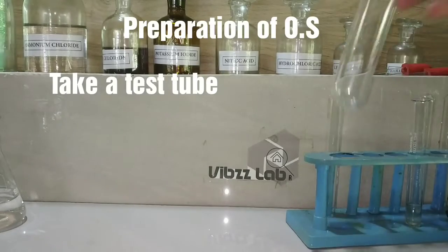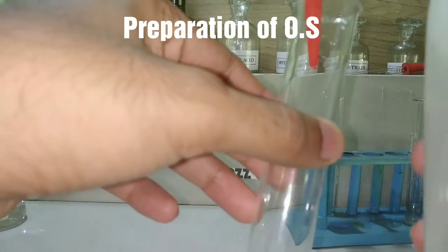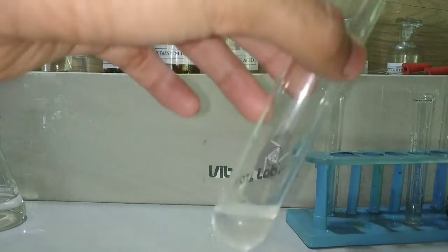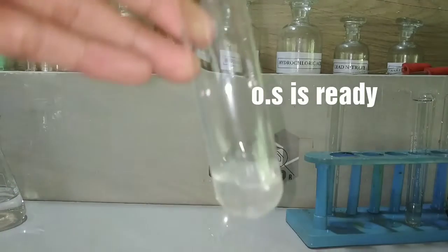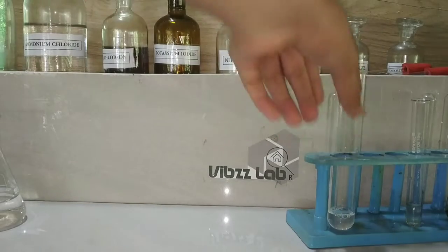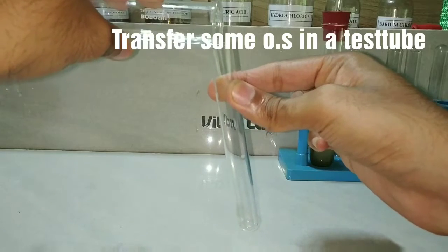Now we will be preparing the original solution. We take a clean and dry test tube and add the solid salt. Now we add distilled water into it and mix the contents. The salt has dissolved in water and we have obtained the original solution.